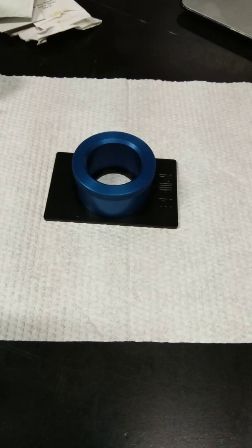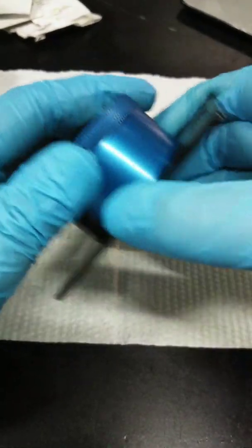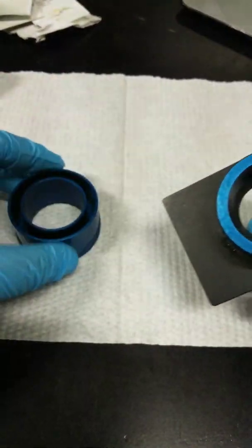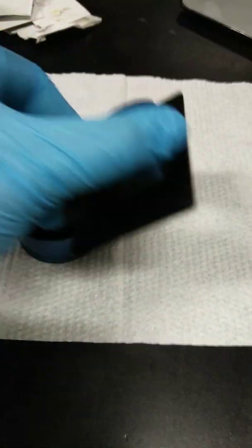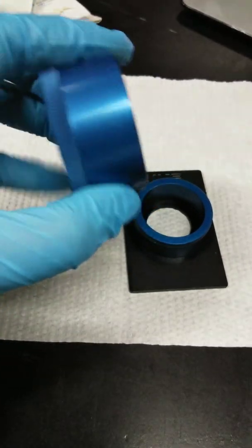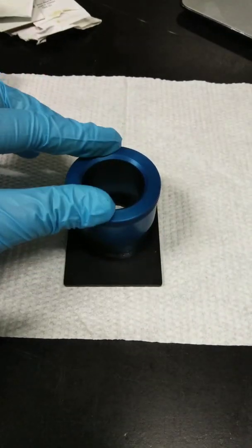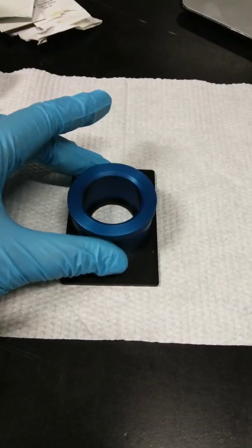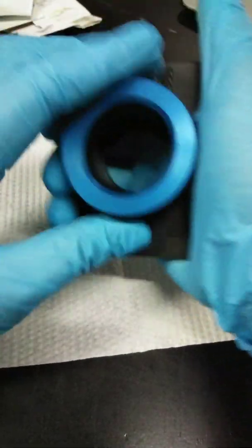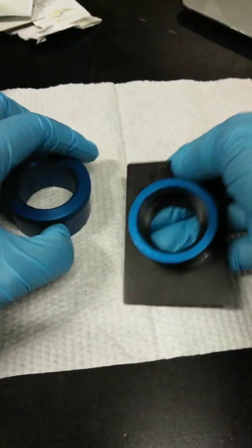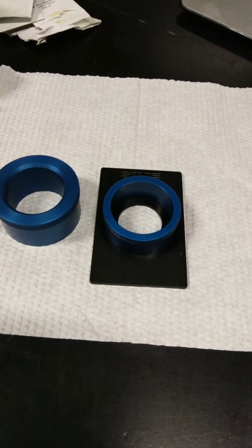The next thing I'm going to show you is the cell holder components for solid sample. So these are the components for the solid sample. So first you have your slide mount. So same like as your liquid sample. But you need this self-locking barrel to place on top of this. So how do you place it on top? You just push it. But be very careful in doing that because when you have already the window inside, if the force is too much it might break. So what is the assembly? Actually more or less it's the same for your liquid sample.